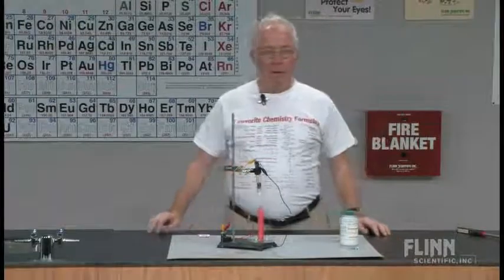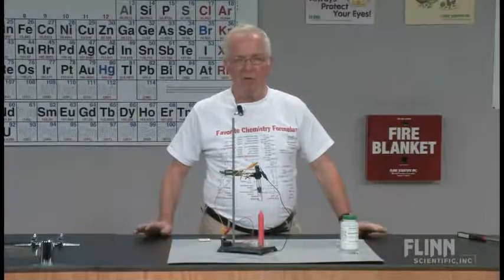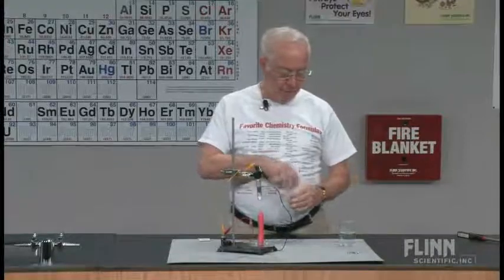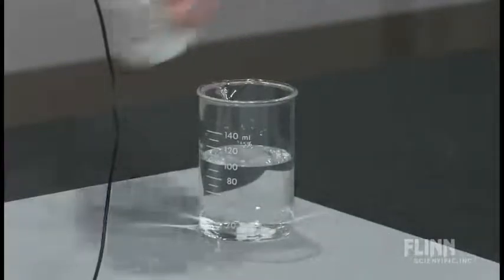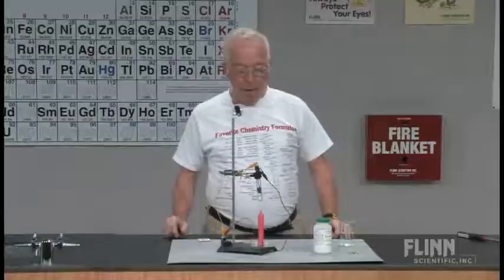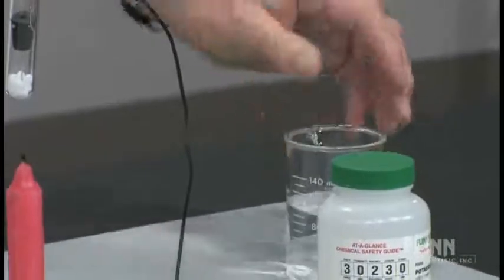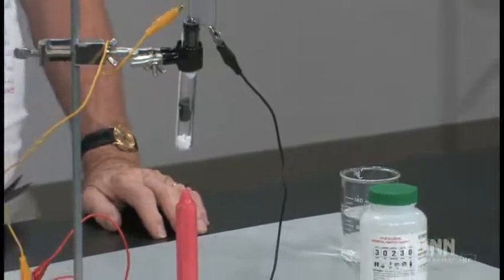We're all familiar with the effect of adding potassium hydroxide into water and then testing with a conductivity meter. This is standard practice. So, if we dissolve some potassium hydroxide pellets into water and then take these leads that are in the test tube and immerse those leads into this beaker of potassium hydroxide solution, we know that the electrical circuit we've got set up here will be complete.